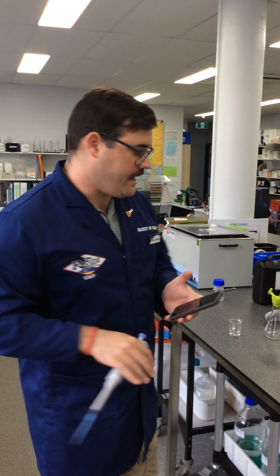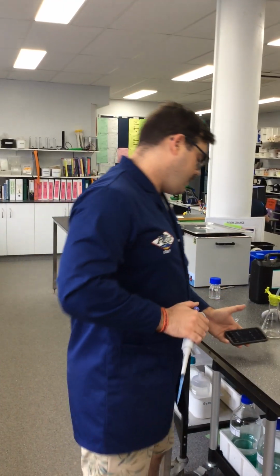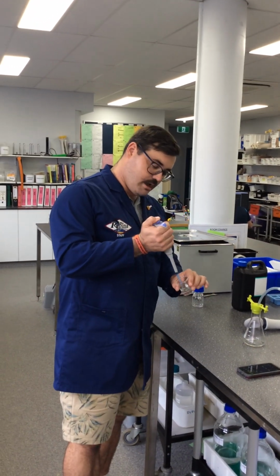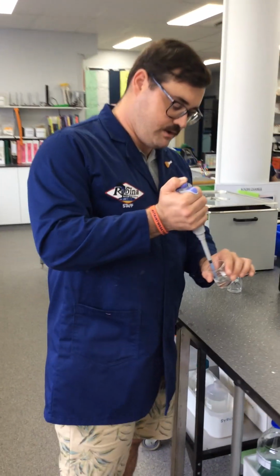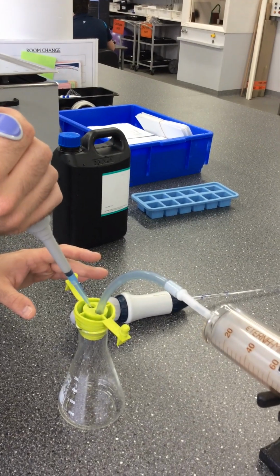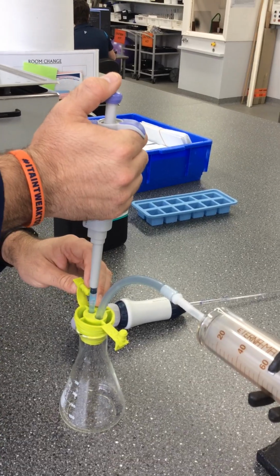And it's going to be a little bit of a mad dash because usually you would have help. Alrighty, so you can come up nice and close for this one if you want, right on that syringe and set up. Okay, so we've got this here. I'm going to squirt it in, and then we're going to start the timer straight away.